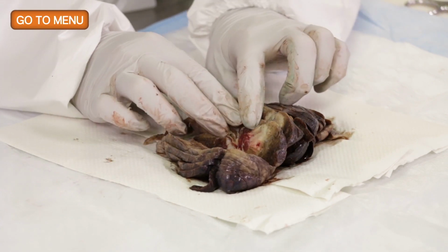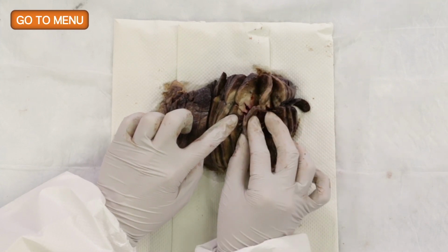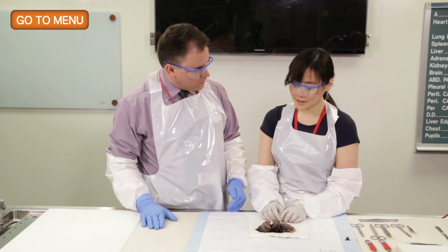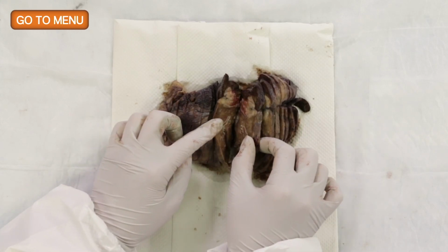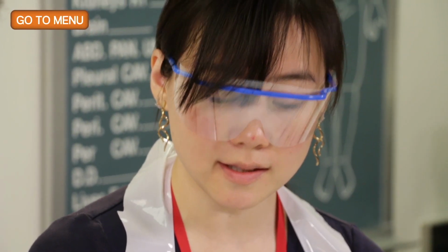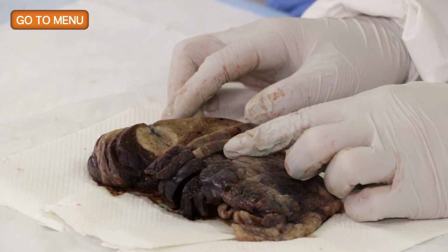So with that in mind, you feel that this correlates well with the CT appearance of the tumor, and that this is in fact the tumor mass that was found by CT scan. Yes, I think so. So what would you like to do next? So what I would like to do is assess the tumor closest to the bronchovascular margin, and from there I would make my measurement, and then I would also like to, of course, have a gross measurement of the tumor.